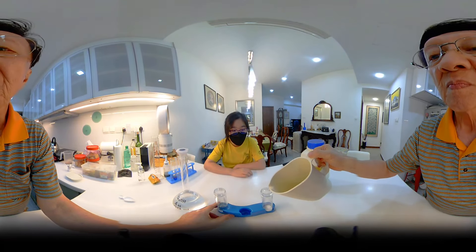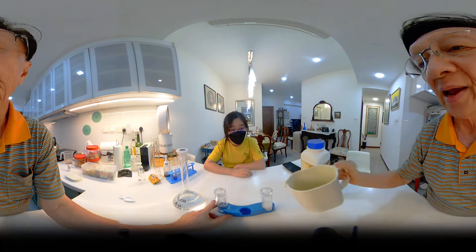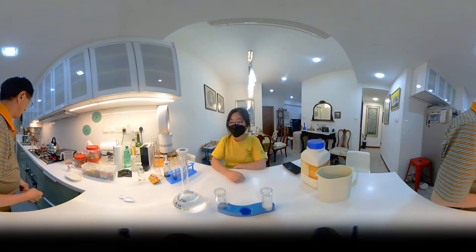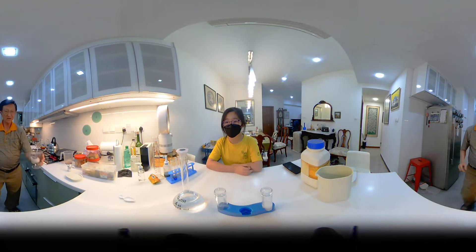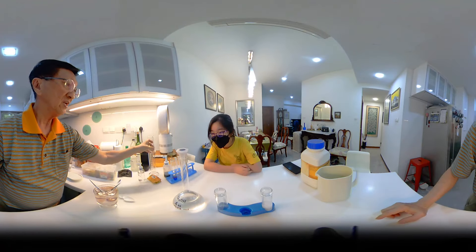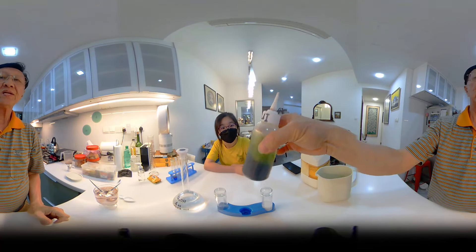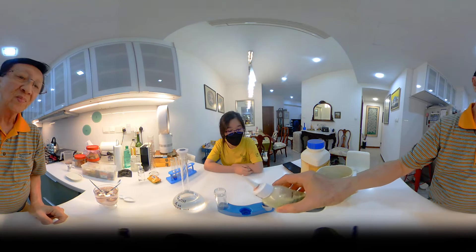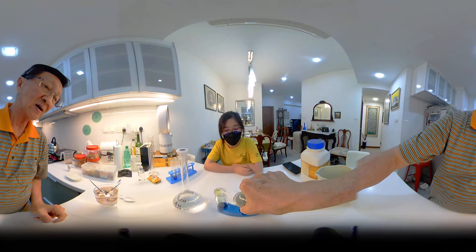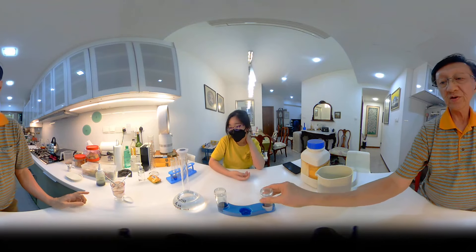What's going to happen is I'm going to put this in water. And you will find that if I put in UI, which is a green indicator, then this will turn purple — this will also turn purple. So both of them turn purple.